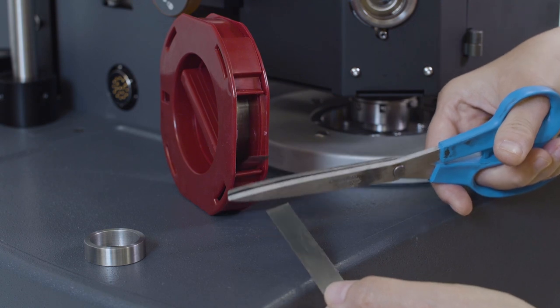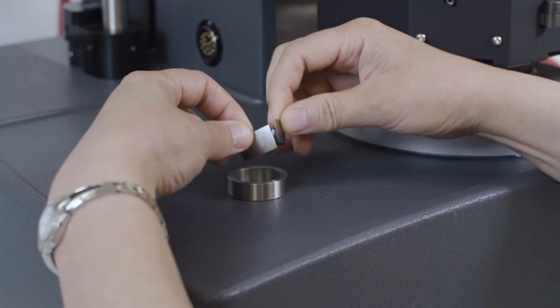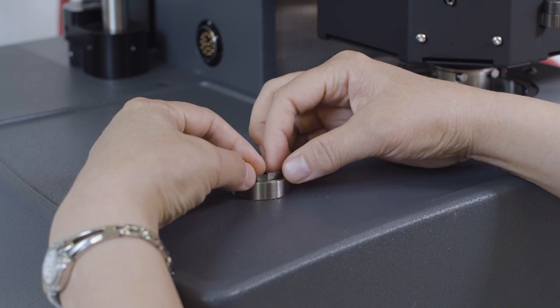Cut a piece of steel shim. Bend it and insert it into the sample molding ring.